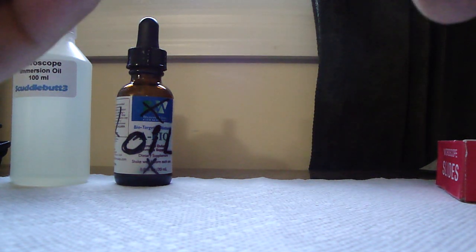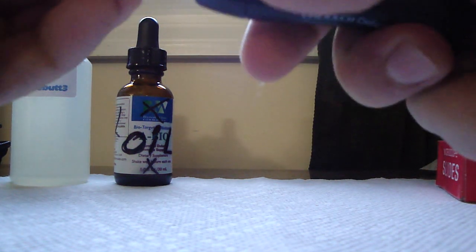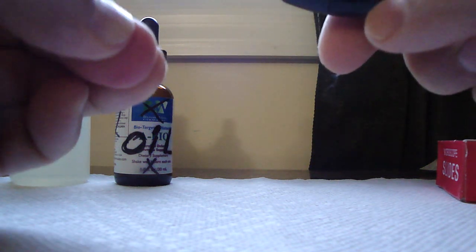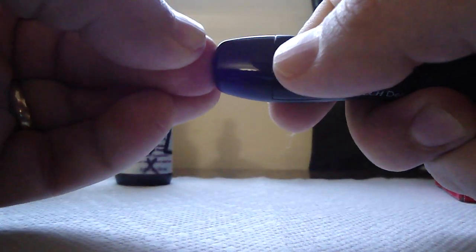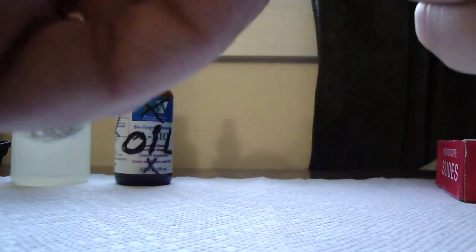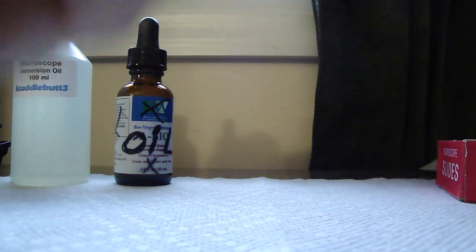What I'm doing is pulling back the trigger. I'm applying pressure with two other fingers to my middle finger and then applying pressure on the lancing device so we can get good penetration. I'm going to squeeze this out a little bit. I have a little blood here if you can see. Onto the slide. I usually do it off-center. I don't put it directly in the center of the slide, a little off-center. I'll show you why in a few.